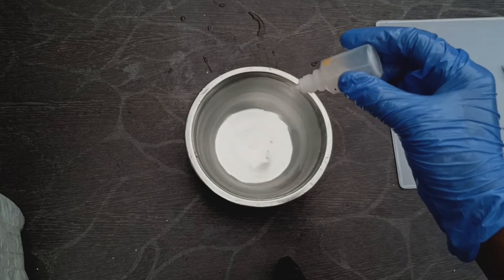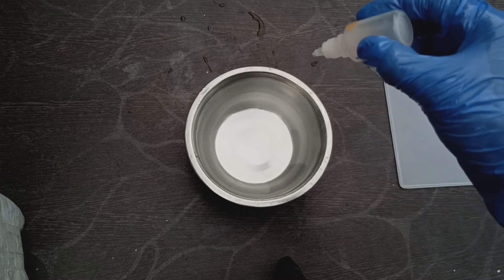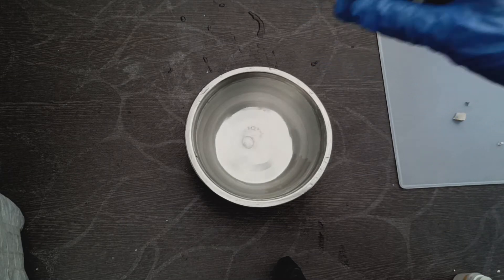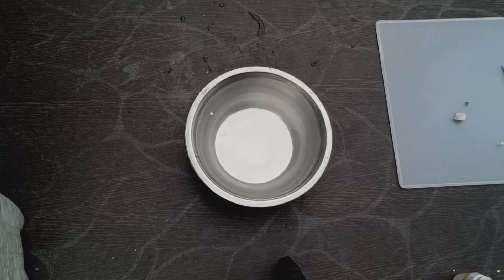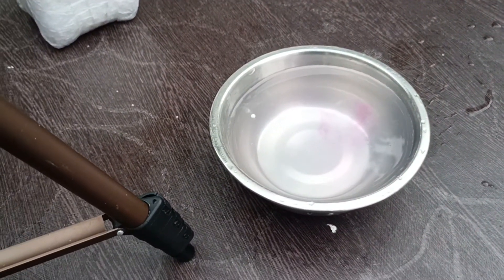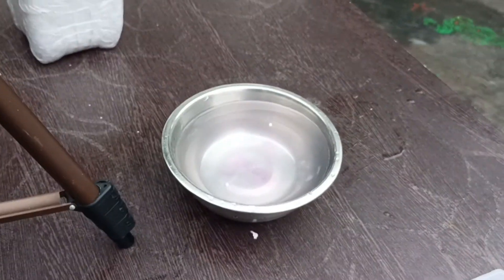To show you that sodium hydroxide is being released, I am adding a bit of phenolphthalein solution. If phenolphthalein solution is added to a base, it turns pink. When sodium reacts with water, it produces sodium hydroxide. So you can see a pink path along the sodium metal. You can see small pinkish tint lines — very light pink, as it's not so concentrated.